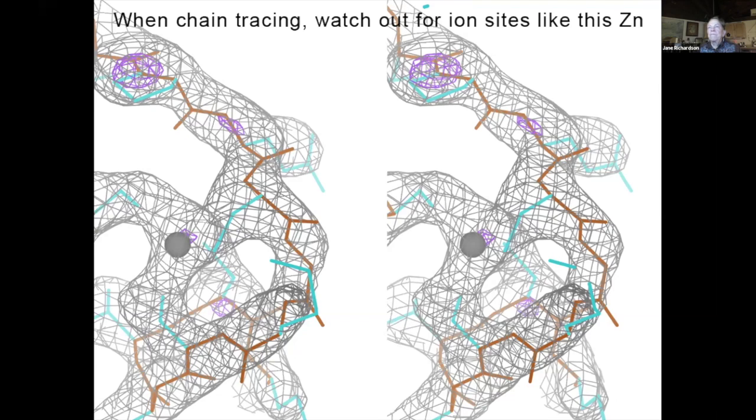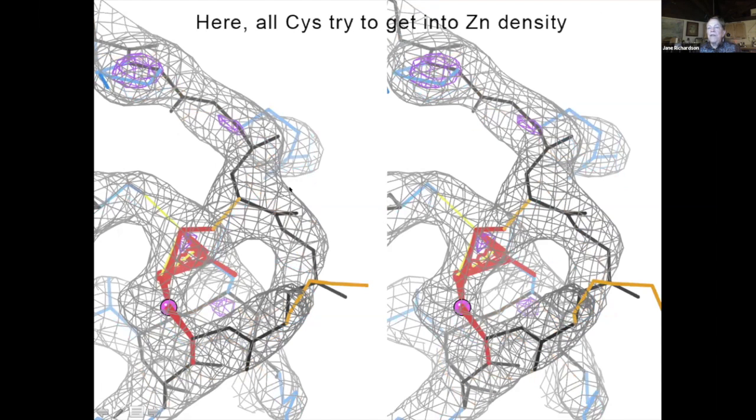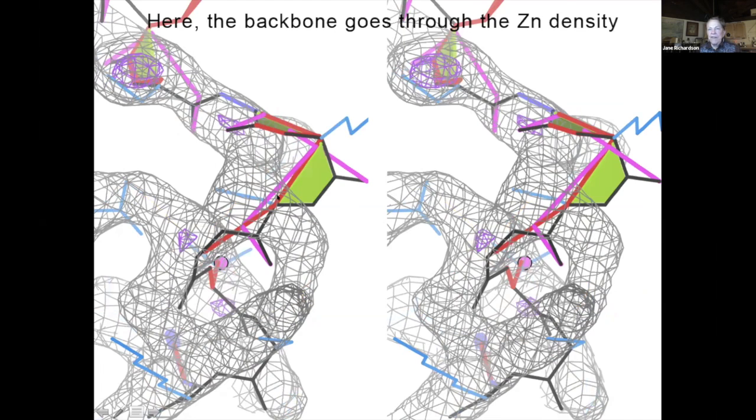So for instance, one of them is that if you have an ion site that you don't know about, then the chain tracing is not very reliable. So this picture has the right answer. That's a zinc site down there. And the chain should go around it and it should have 4 cysteine ligands. But if you don't know there's a zinc there, in this case, all the cysteines tried to get into the zinc density. And even worse, in this one, the main chain went through the zinc density, which really made a mess. So that's one thing you can look for. Look for patterns that look as though the connectivity is more like all of the density that would connect into an ion.